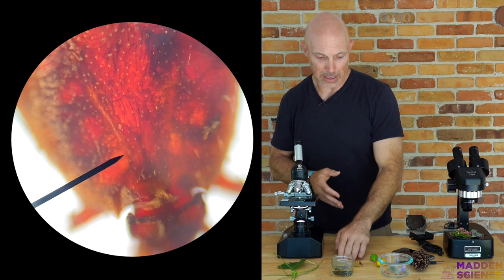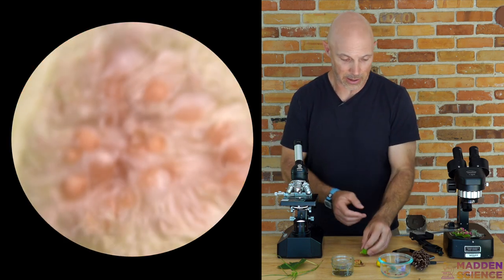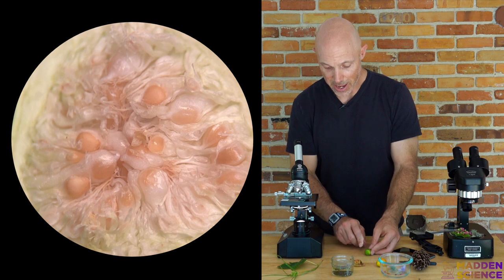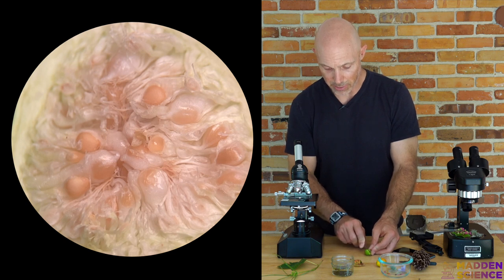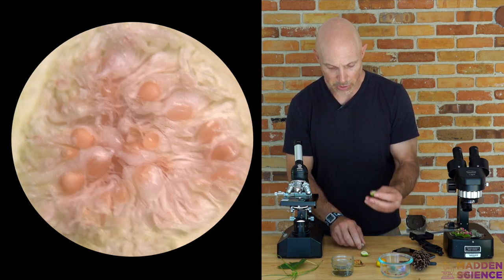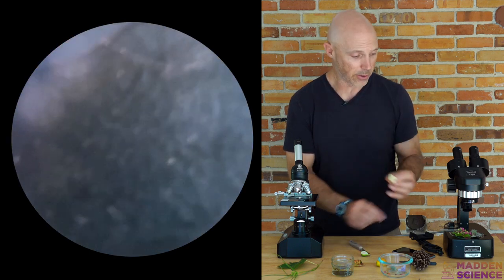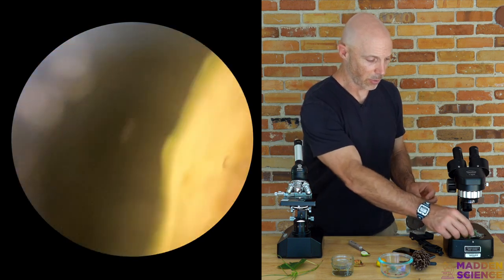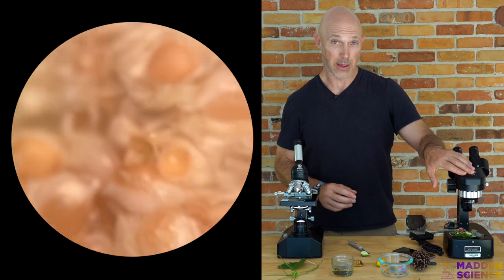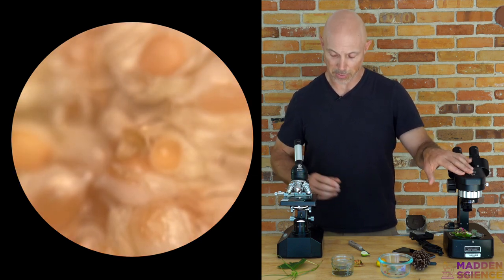Something like a leaf, or if you had something 3D like this fig — you could take a slice and look at it under the regular light microscope, but this suits you better by looking at it under a dissecting scope. So the more 3D it is and the bigger, the more likely you are to use a dissecting scope.